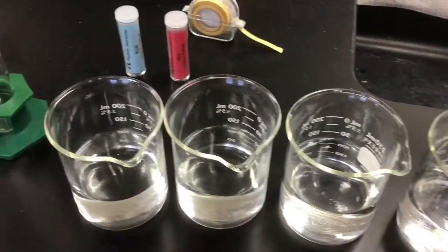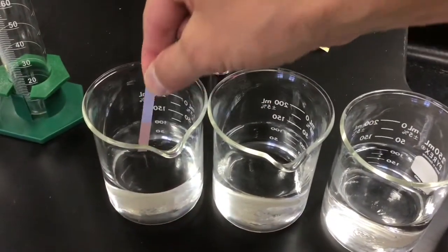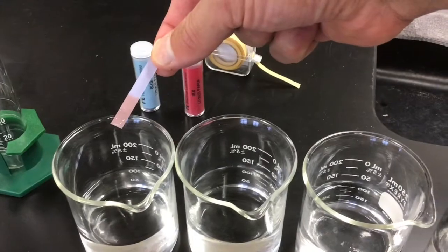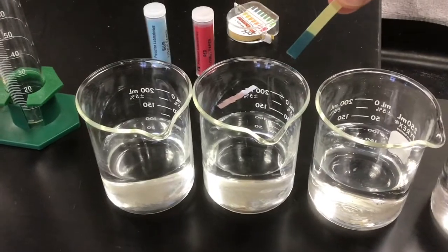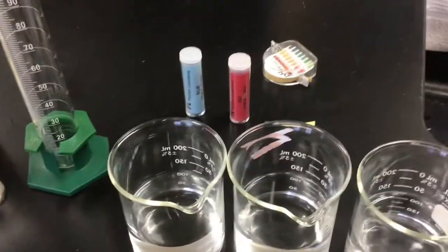Here are our four solutions we're testing. They might look like water, but a test like that will show that it's an acid. If we use the pH paper, a test like this shows that it's a pretty strong base, so those would not be water.